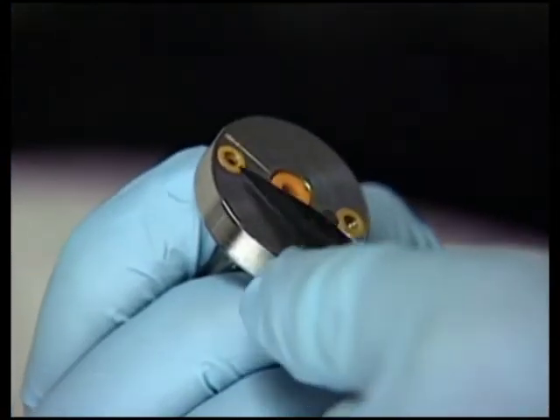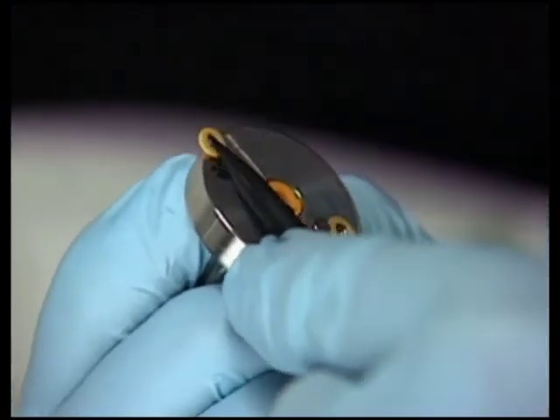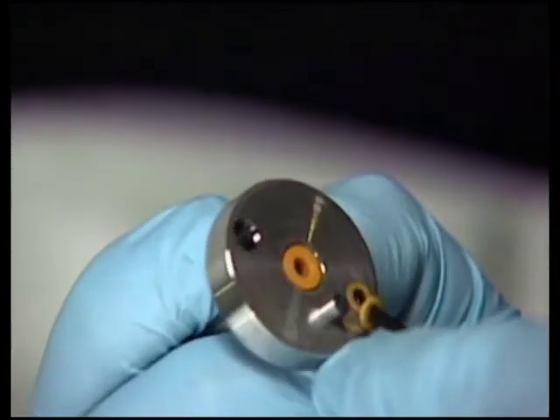Again, being careful not to scratch the surface of the head, use a blunt tool to remove the face seals from the head.